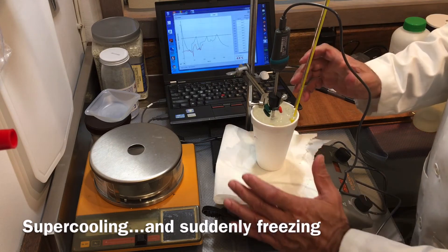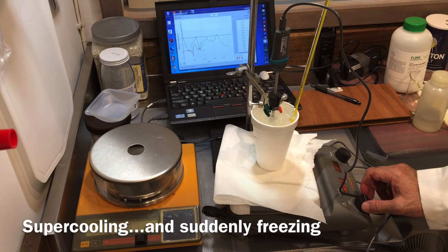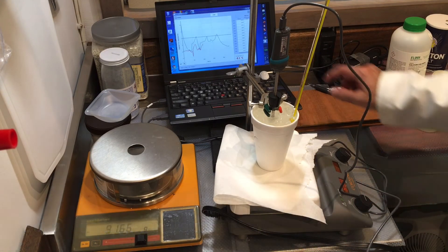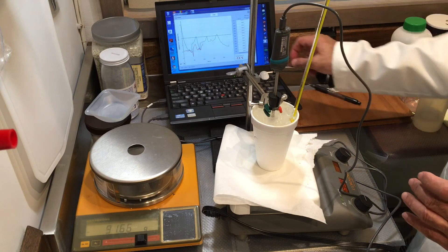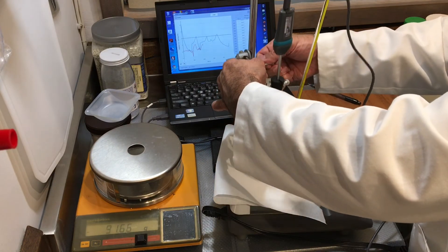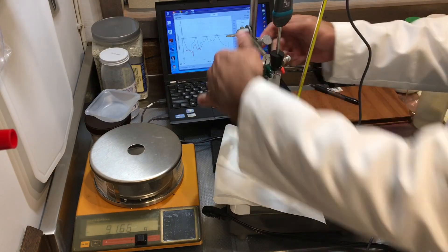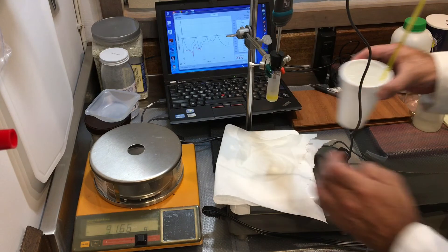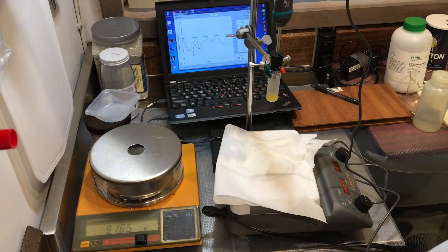It just froze, I saw it. Temperature is rising. Oh, there it is.